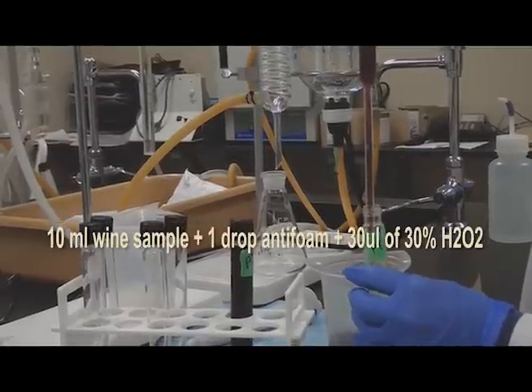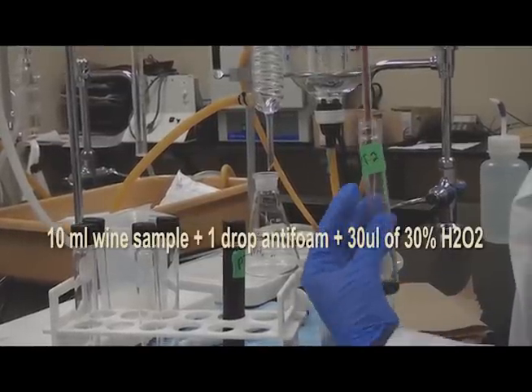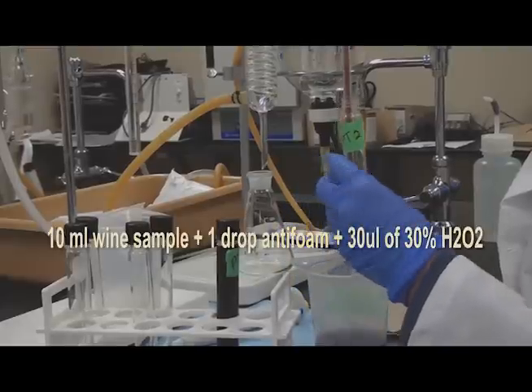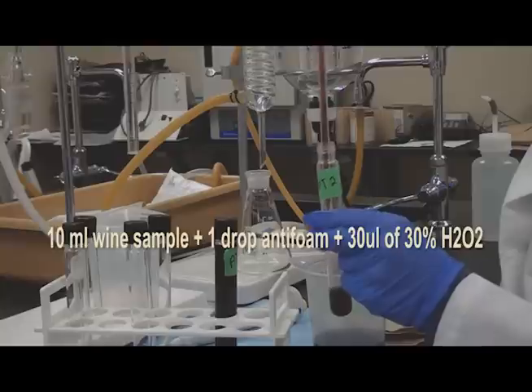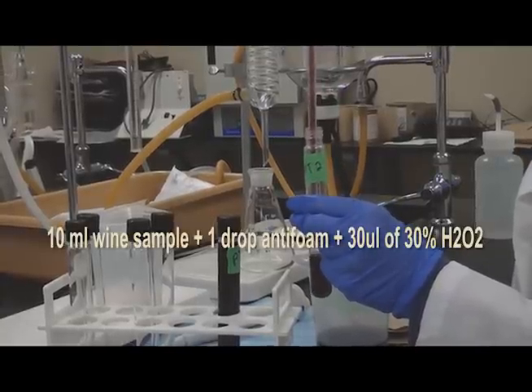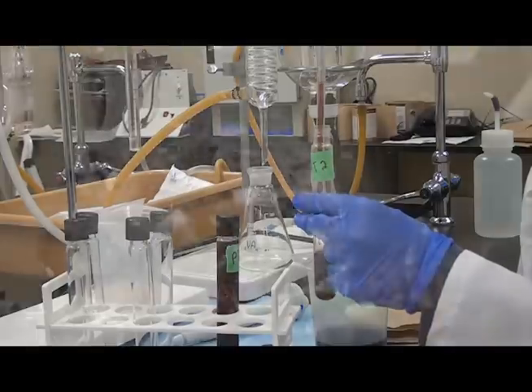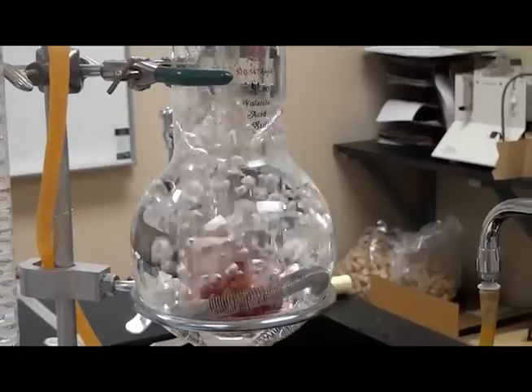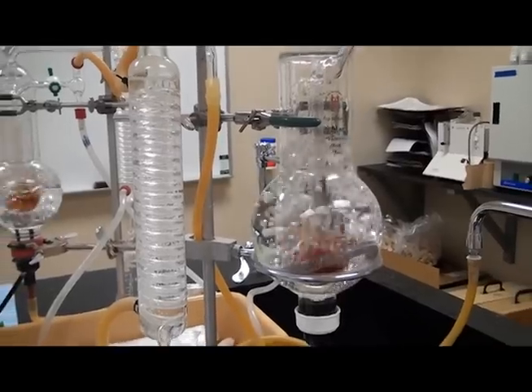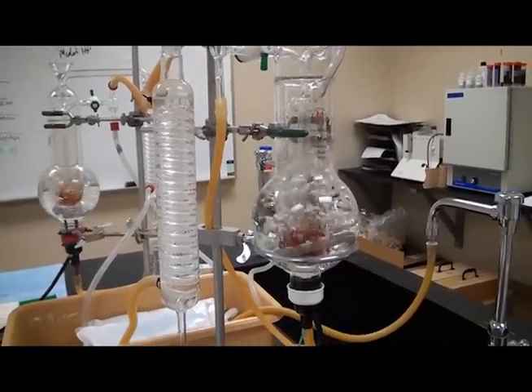Running a wine sample: use the same procedure as the acetic acid standard with a 10 ml wine sample in the test tube instead of the acetic acid. Capture the distillate and titrate using the same method shown earlier. If there are multiple samples to run, prepare all of the samples and then run them in succession using both cash stills. Each sample should be run in duplicate to assure accurate results. Be sure and give yourself enough time near the end of the day to clean the stills.